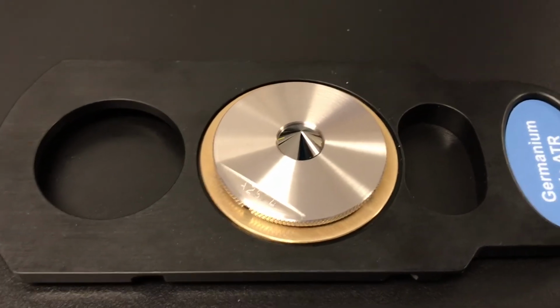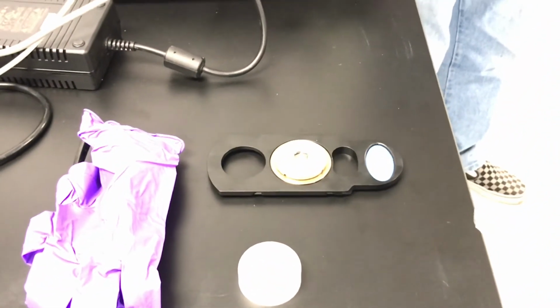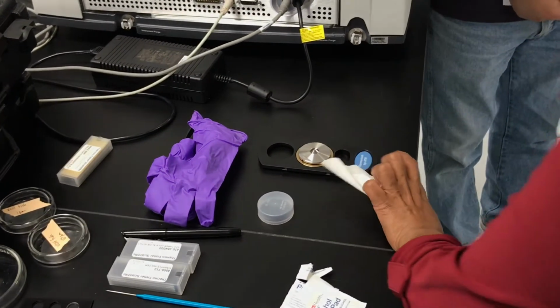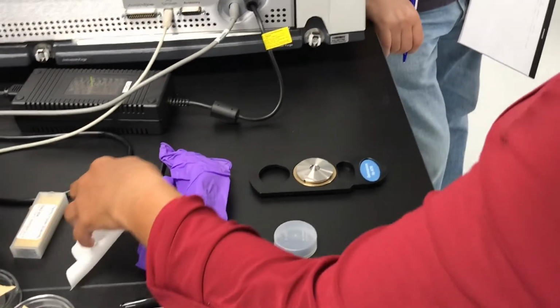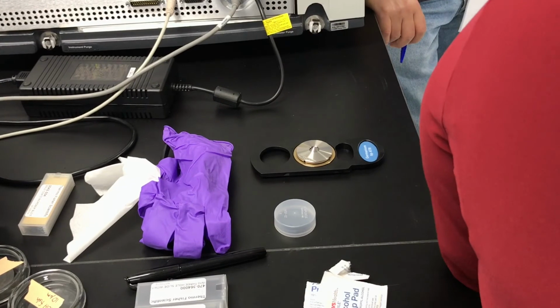you may have heard this from our service engineers. No Kim wipe. You will destroy it, over and over. Never use a Kim wipe. Yes, they are extremely cautious because it happens. They said it was okay, but they have clay in them, I guess. If they have some clay in them, it can scratch over time.